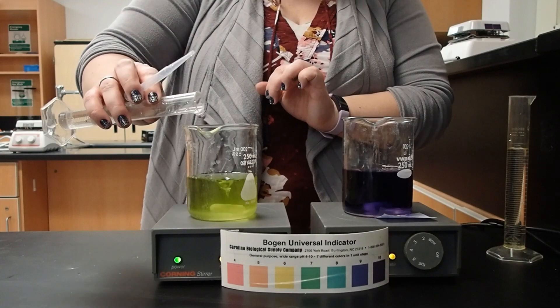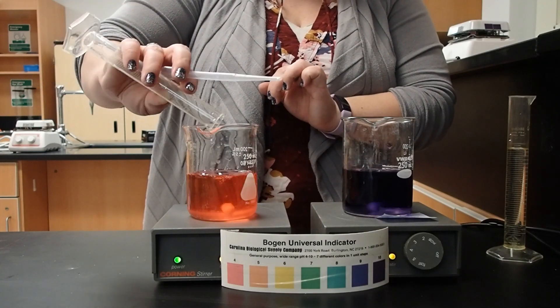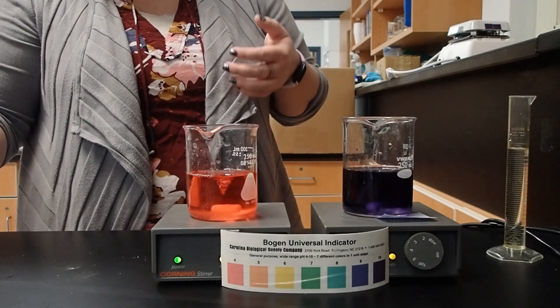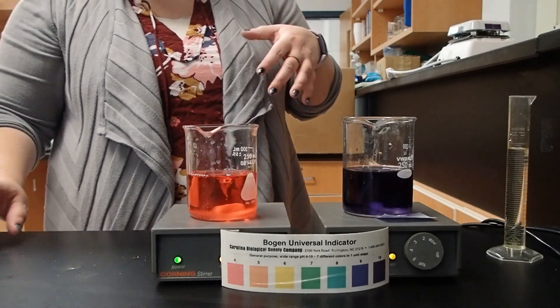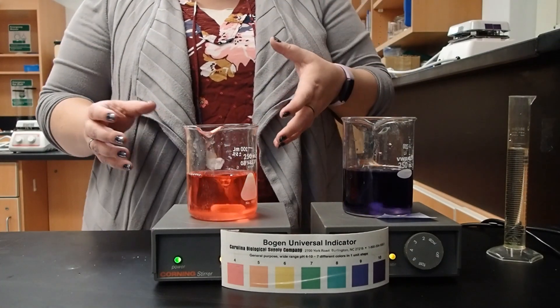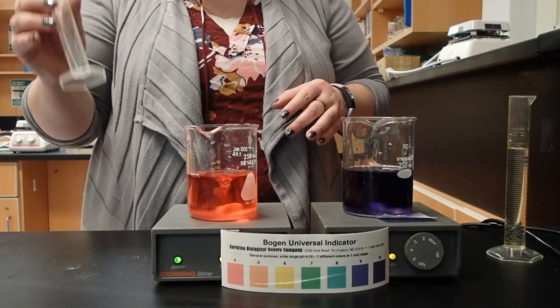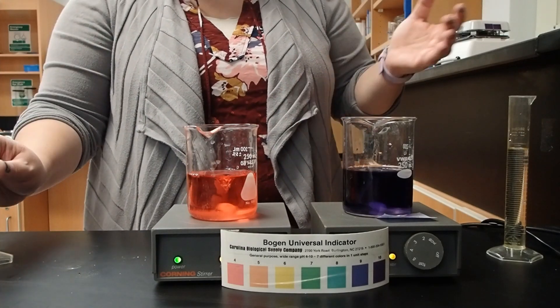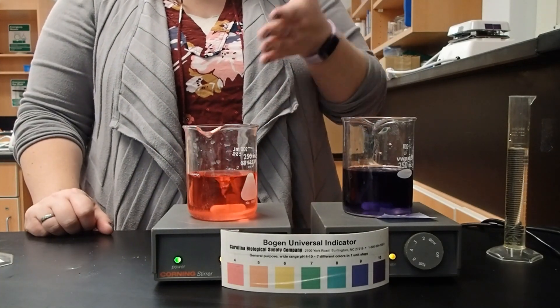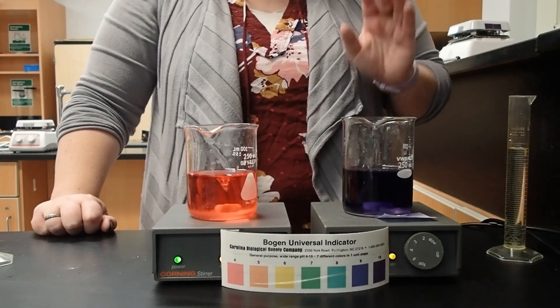At this point I can pour in the rest of my acid. So in our non-buffered solution, we did have the ability to neutralize our basic water, but because of our acid, we went past our point of neutrality and all the way into a very acidic solution.